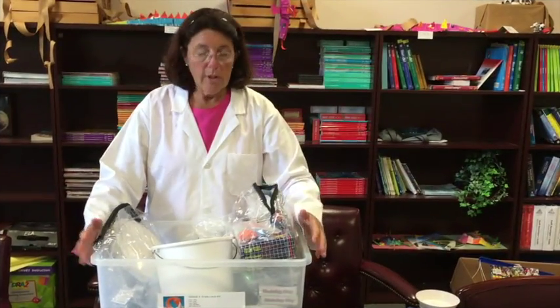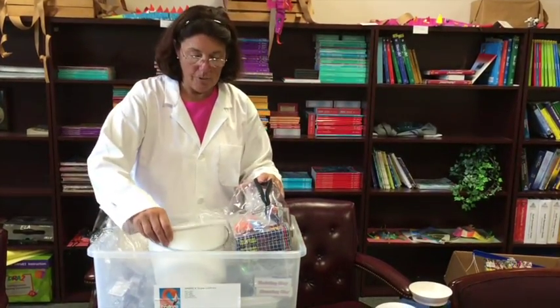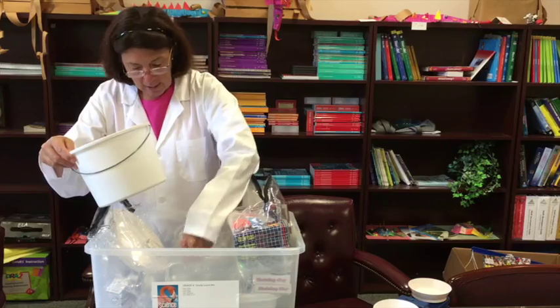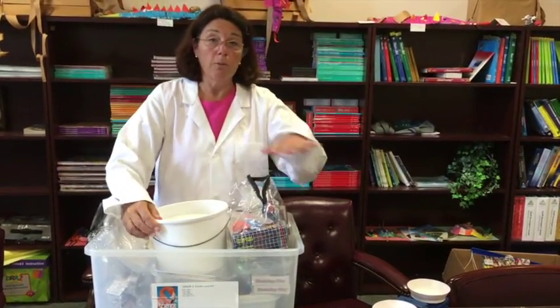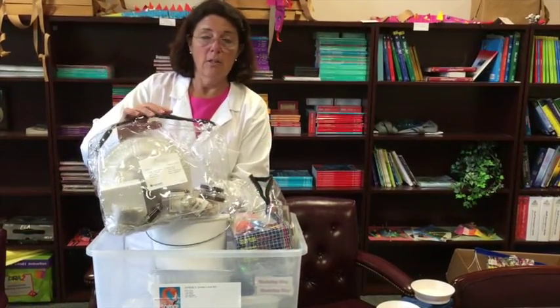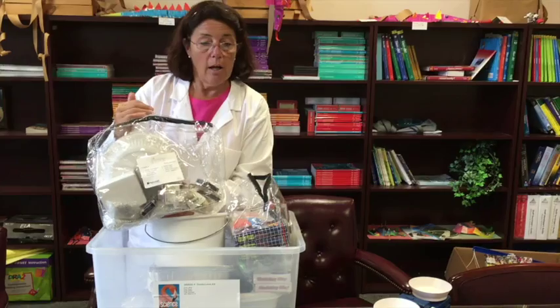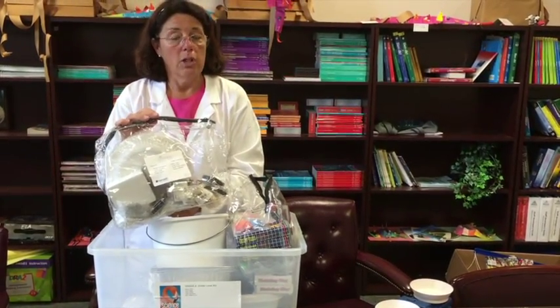All right, so here's an example of the Harcourt Science or HSP kit. Inside the kit, you will find common materials like buckets or hot water pots, even things like funnels and aluminum pans. These are things that can be used across multiple grades or multiple classes. What you'll also find in the kit is individual bags. This is an example of a bag, materials for a fossil activity that aligns with Chapter 8 in the 6th grade textbook and also Unit 9 in our new sequence of units.